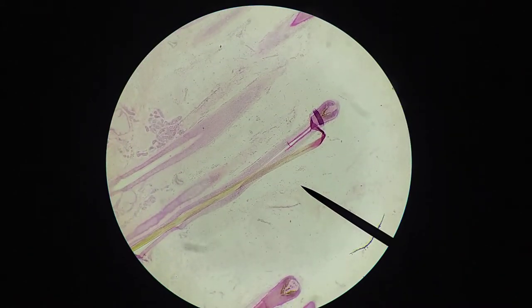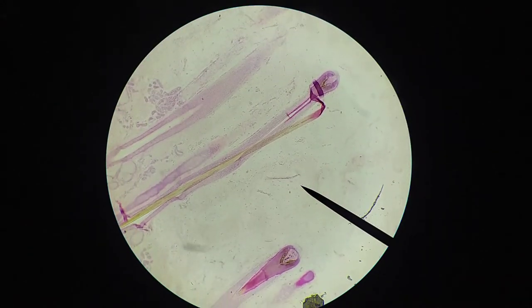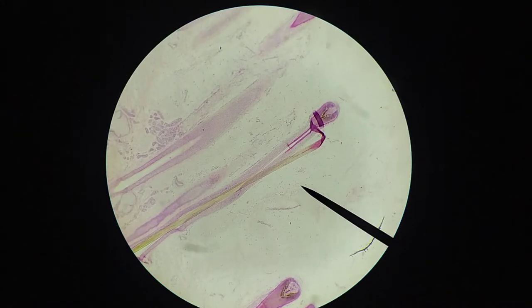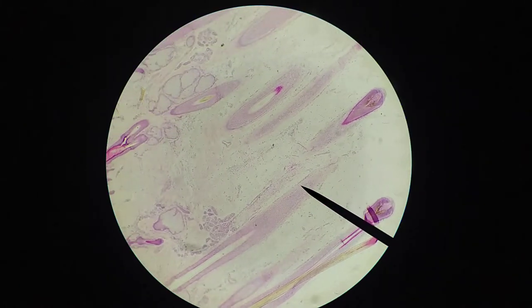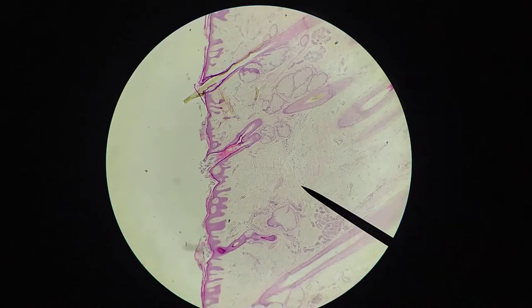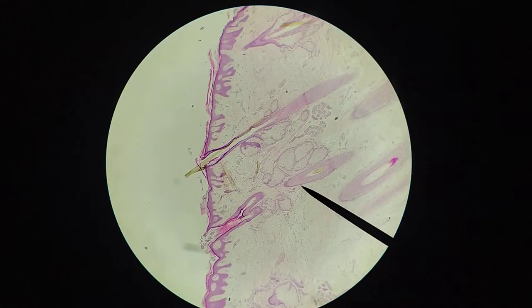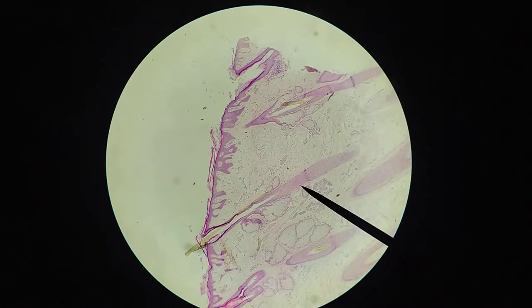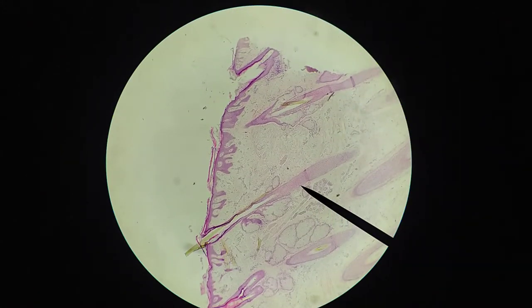This lighter-staining region is the hypodermis, and this is where we find the fat — the adipose tissue. There are also lots of hair follicles throughout this region.